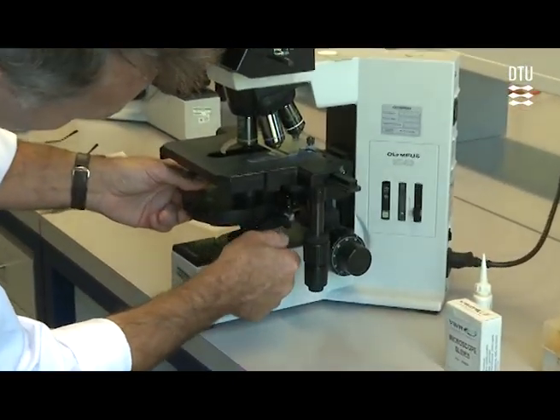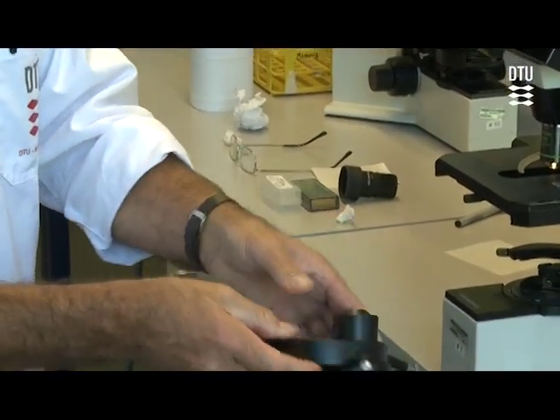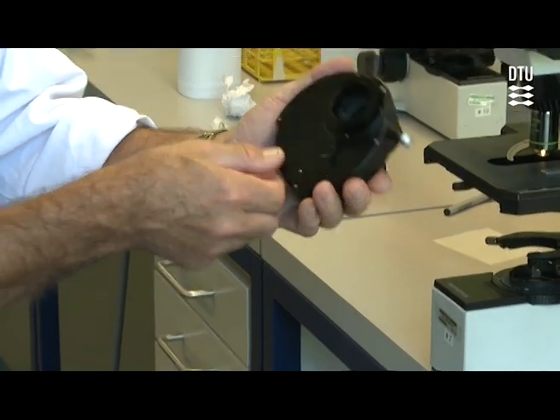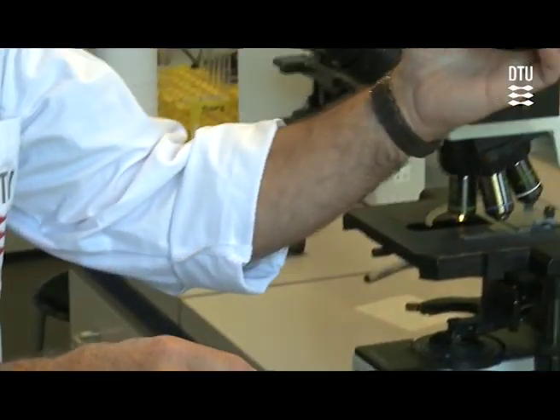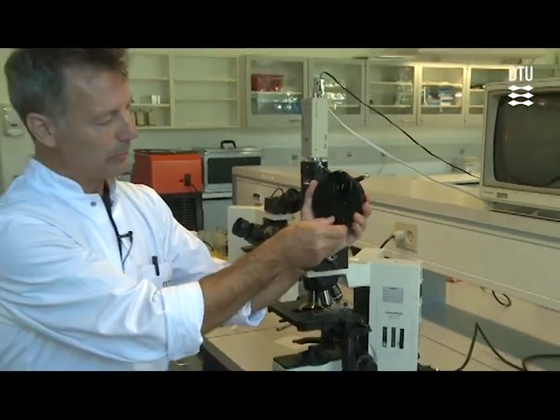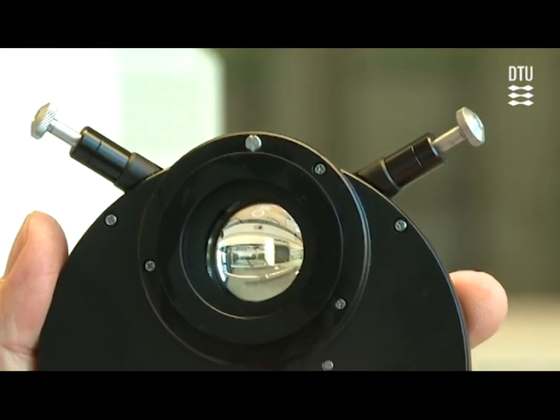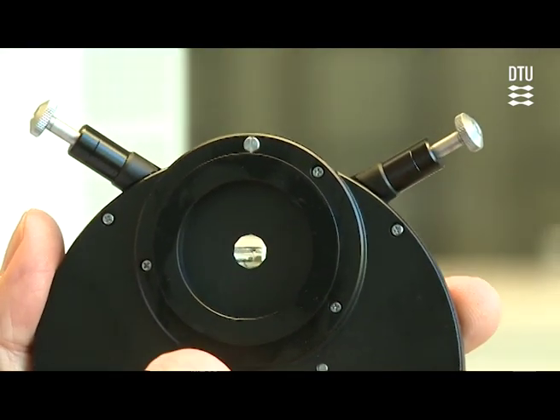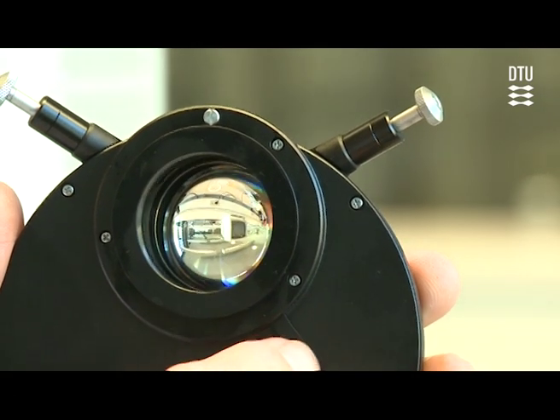get it right again. You can take it out, and it has a range of settings that is easier to see if you look at it from this direction. You can turn it around, and the first setting is just open. If we look at it up close, you can see we can close an aperture almost totally, but that's only possible in the first setting.